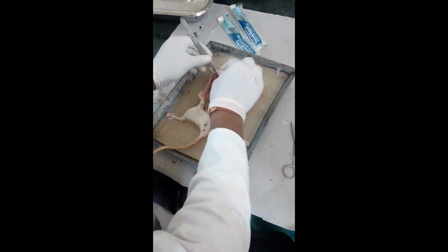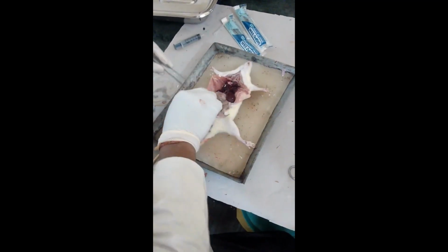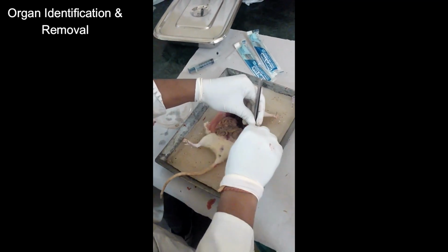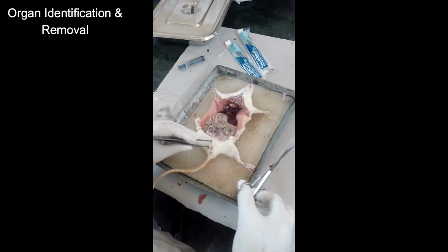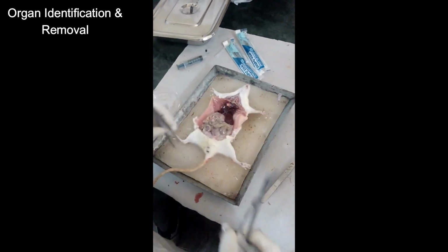Open the thoracic cavity to assess the lungs and heart. Extend the incision upwards. Carefully cut along both sides of the rib cage. Gently lift the ribs to expose the thoracic cavity. Take care not to damage underlying organs. We will now remove the organs one by one, systematically.